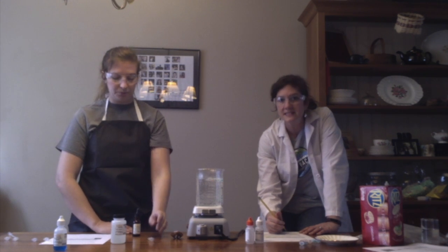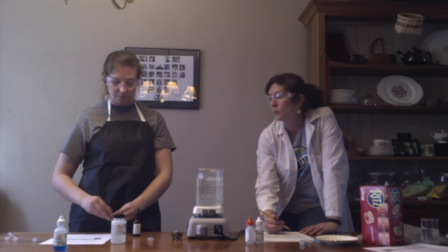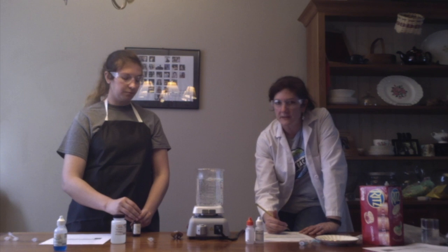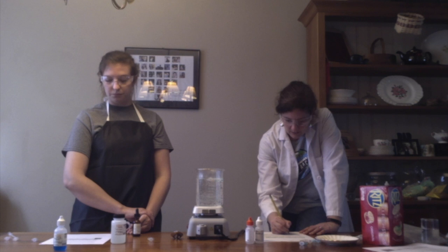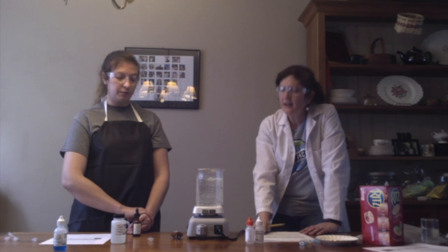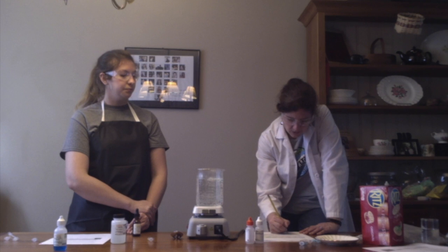Okay, and I'm going to make this adjustment. It may say "color after warm water bath" in your book, but we said we don't need to put iodine in a warm water bath, so we're just saying "color after." And you said that was kind of a yellow. Okay. Is starch present? No, not in the first one. How do we know that? Because if starch was present, it would turn that purpley brown. Okay, so we're going to go ahead and put no.